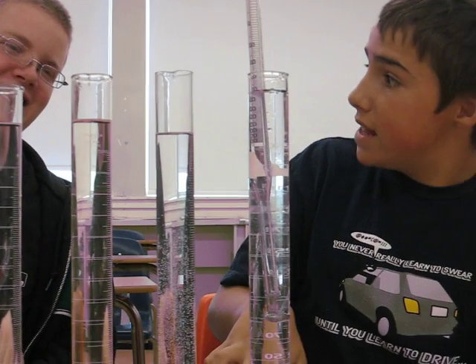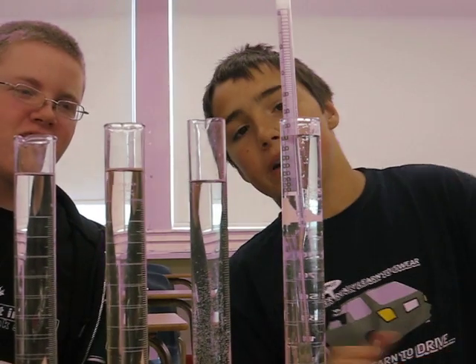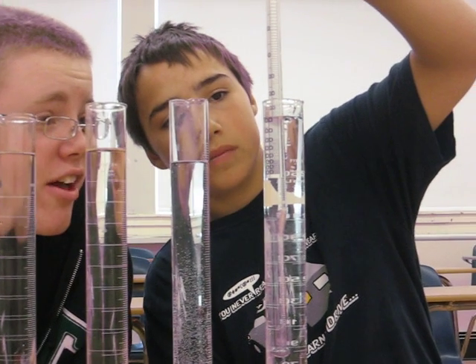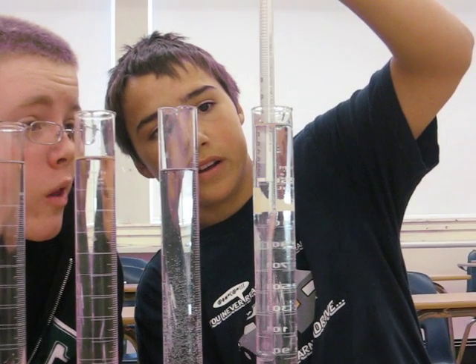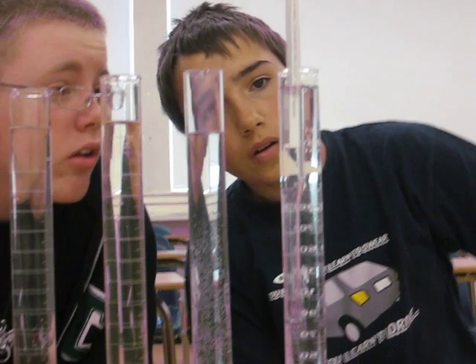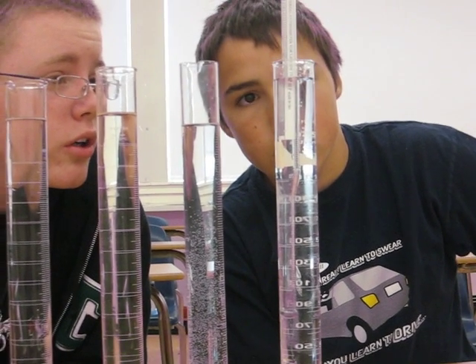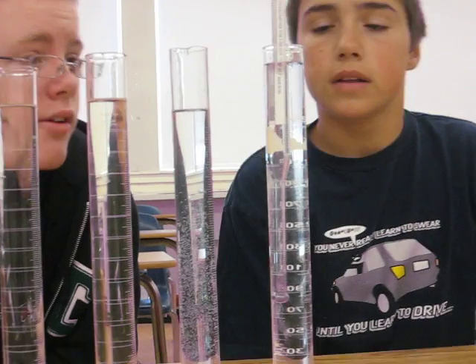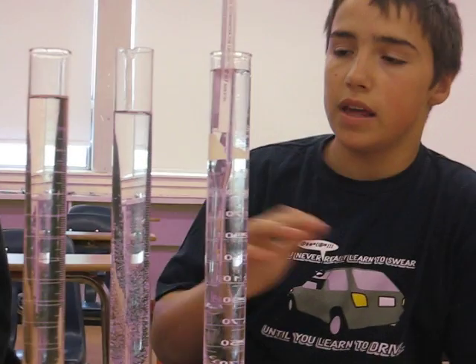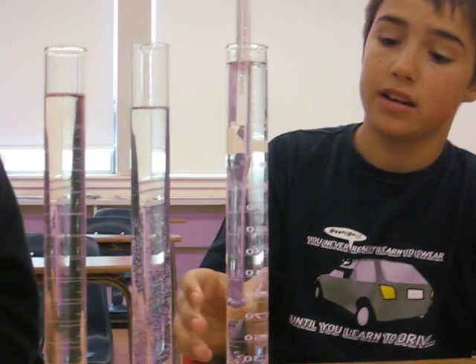Holy, that is dense, is it not? Yeah. So do you want to tell me the reading, Eric? I'm not sure if it's done yet. Looks done. I'm going to turn it around for you, Eric — tell me the reading. Looks like about 1.34. That's interesting because most of these are less dense than glycerol.